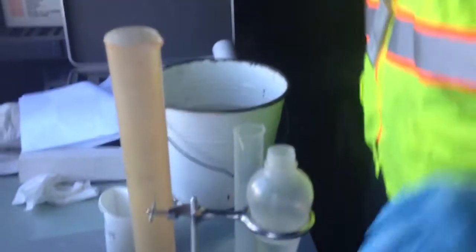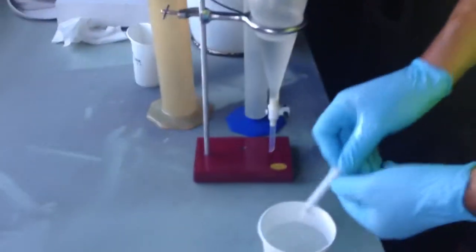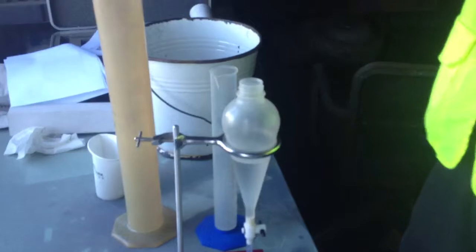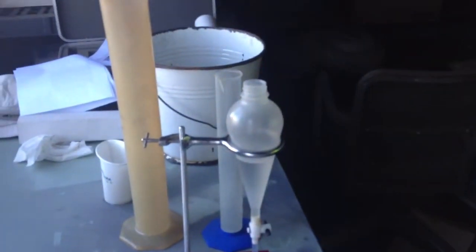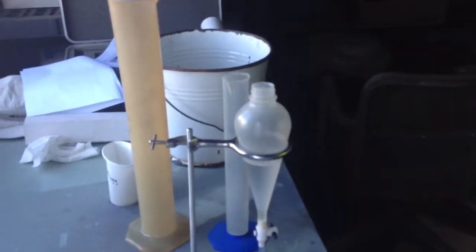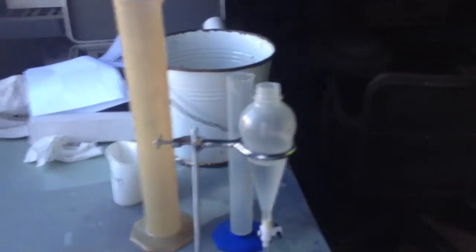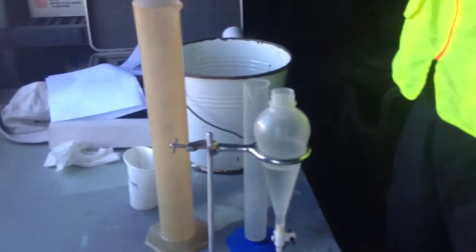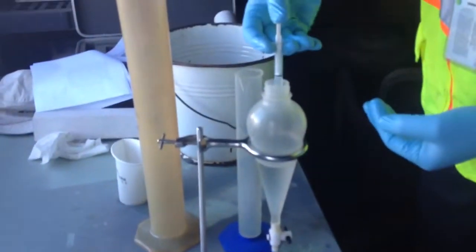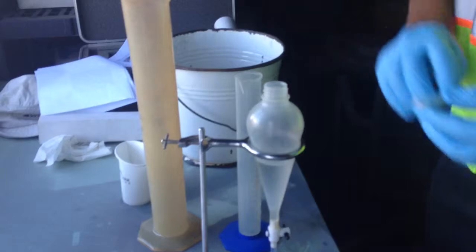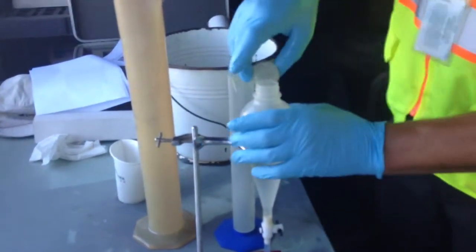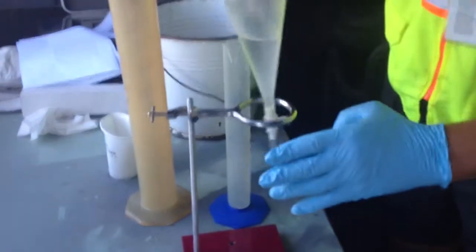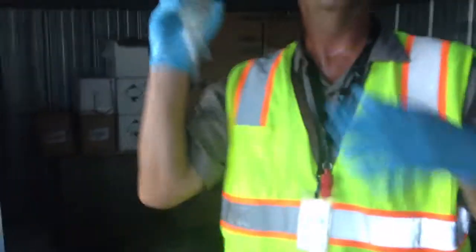I'm going to draw one milliliter of water. One milliliter of water. What's going to happen is, the additive is going to actually attach to the water, and that's what we're going to end up testing. Shake this for five minutes vigorously.